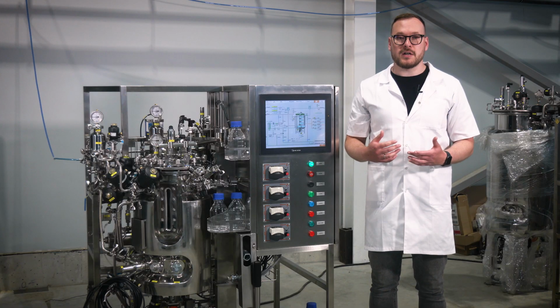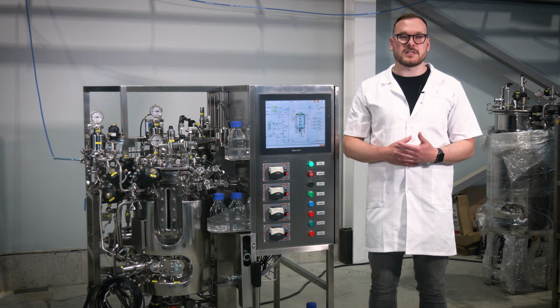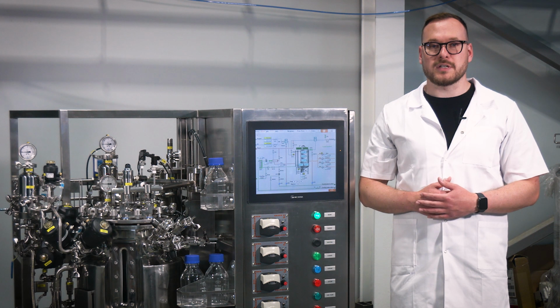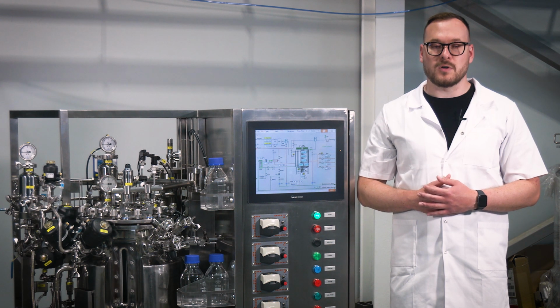To ensure a sterile environment, we recommend sterilizing the entire system. Steam sterilization should be performed to sterilize the air pipeline, filters, and the bioreactor vessel before loading the medium or unloading the product. If the bioreactor is opened during loading, it is essential to perform a complete sterilization of the fully loaded reactor vessel as well.